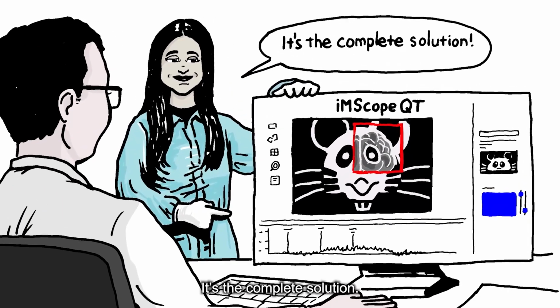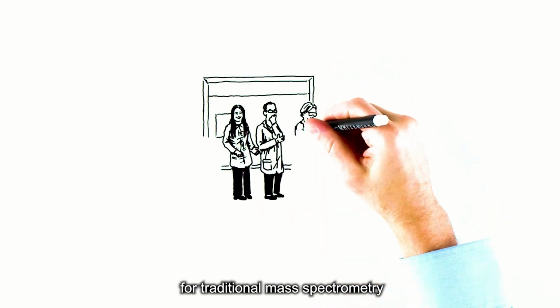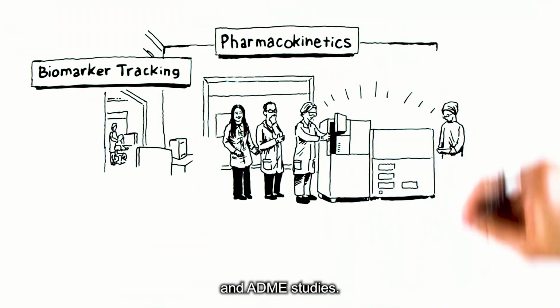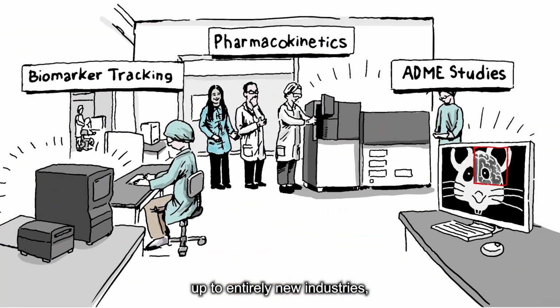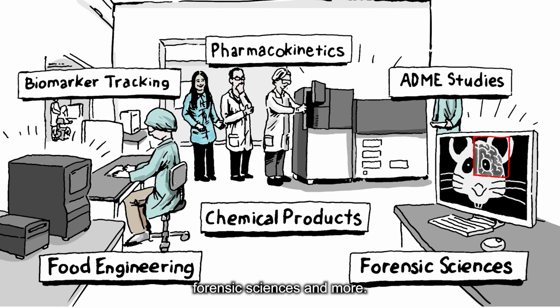It's the complete solution. The iMScope QT is a robust tool for traditional mass spectrometry imaging experiments such as biomarker tracking, pharmacokinetics, and ADME studies. But its versatility opens its usefulness up to entirely new industries, including chemical products, food engineering, forensic sciences, and more.